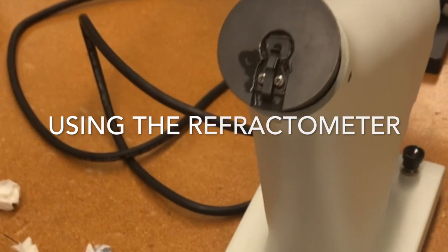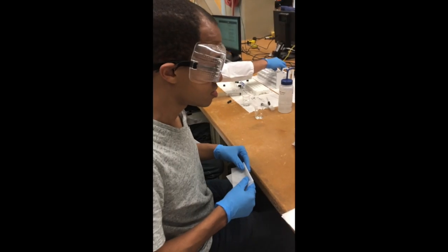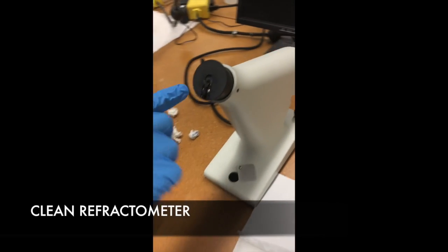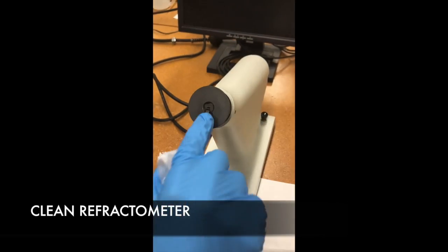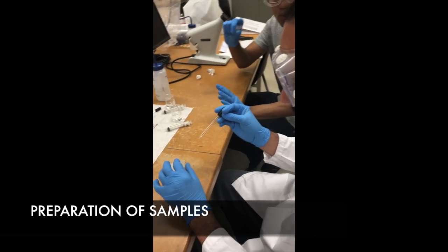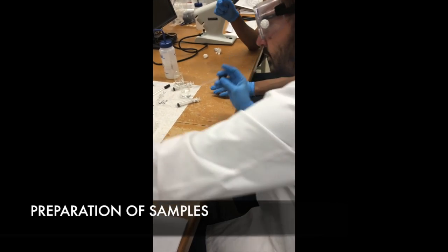Now we have our refractometer, which we will use to measure the refractive index of the samples to determine the ethanol concentration of a sample. Before using it, it is important to clean the refractometer using a Kimwipe. Here we have the preparation of the samples before they are put into the refractometer to be analyzed.